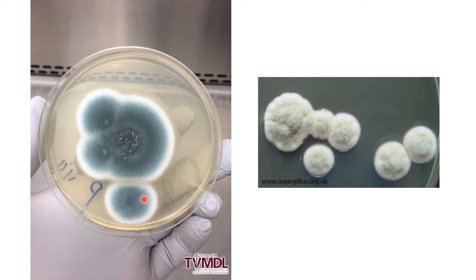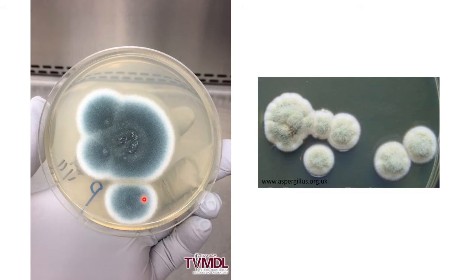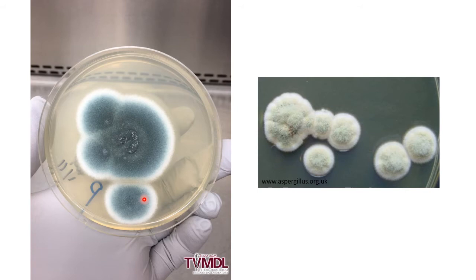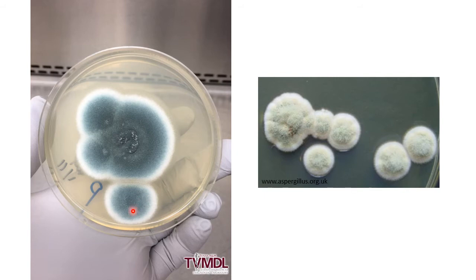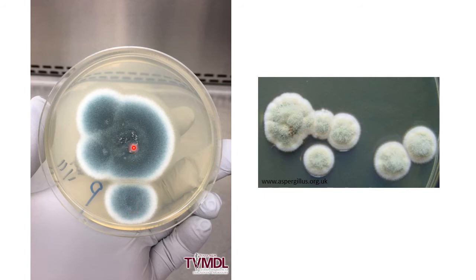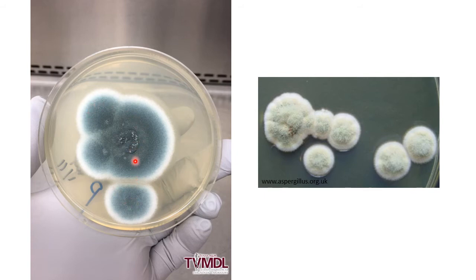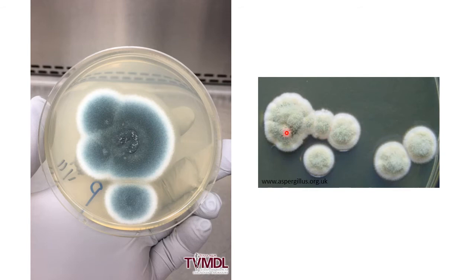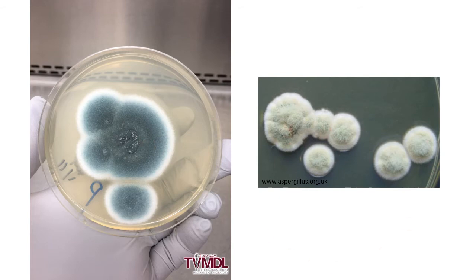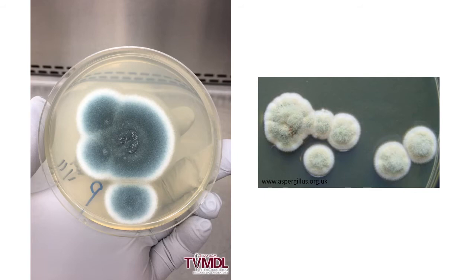The problem with this technique is that if you are not gentle, due to a little jerk or air current, your spores land up beforehand — before reaching the center where you want to inoculate. The spores get scattered on your media plate and you get many colonies across the plate. This is not a good picture to use if you want to publish your work.